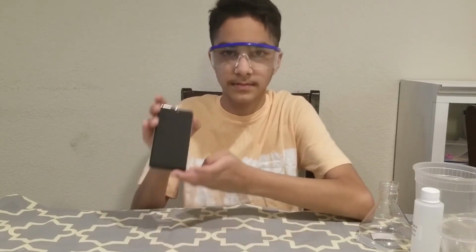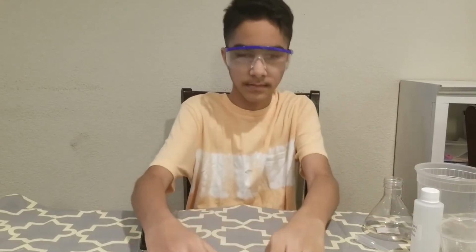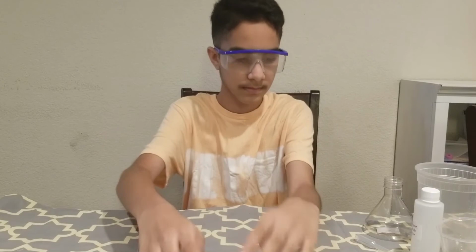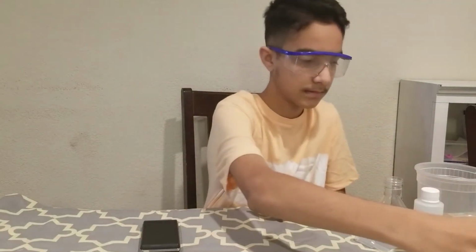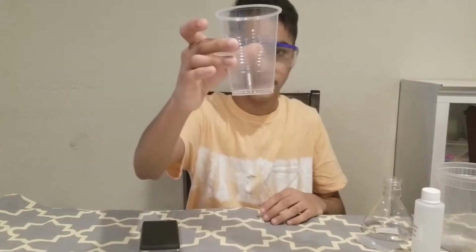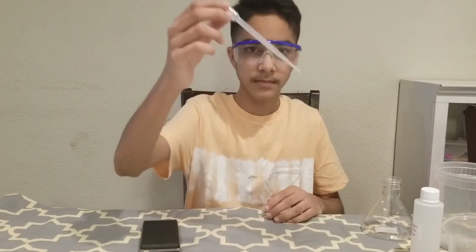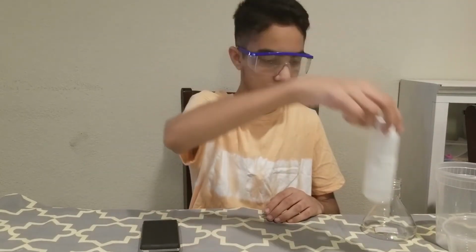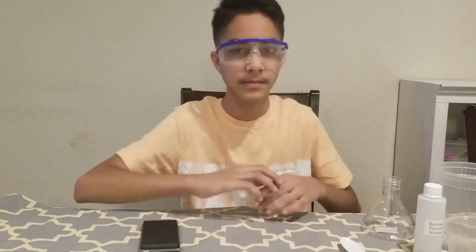We need a digital scale, a 250 ml Erlenmeyer flask, a one-hole stopper with tubing connector and 2 feet of flexible tubing, a 100 ml graduated cylinder, a 10 ml graduated cylinder, a large plastic container, one medium plastic cup, a thermometer, a plastic pipette, a rubber band, hydrogen peroxide, yeast, a spoon, tap water, and a cell phone to look up local air pressure.